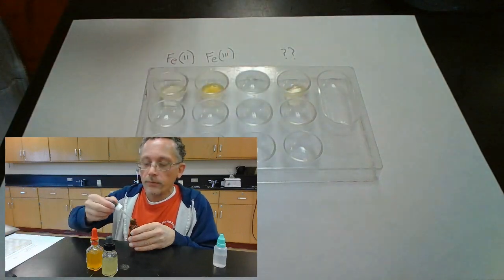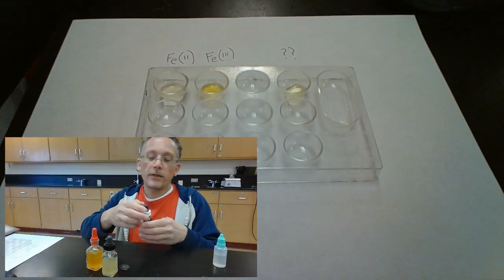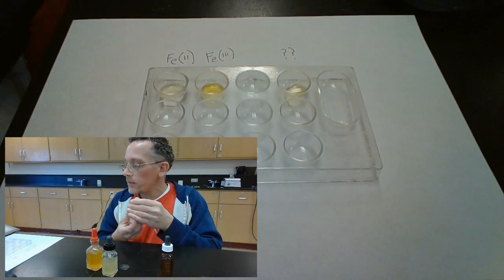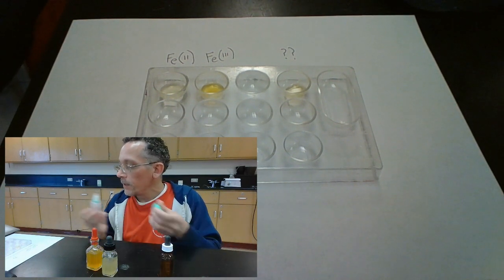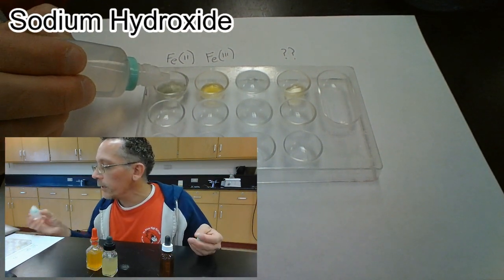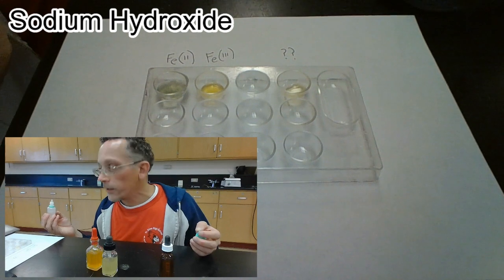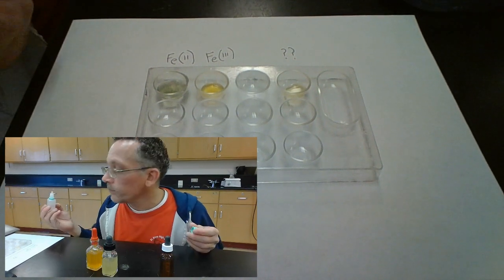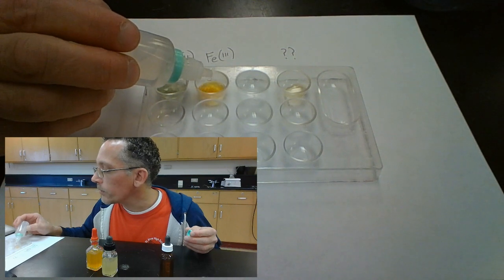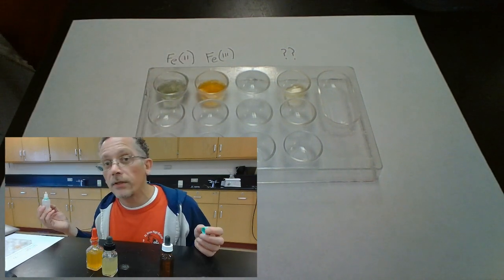It's one or the other one. Already it kind of looks like one and not like the other one. So let's put some sodium hydroxide and see how they behave. The iron 2, we should get a green precipitate. And yep, I can see a green precipitate in there. Hopefully you can see it well. For the iron 3, we should get a brown precipitate. And yep, that's definitely a brown precipitate.